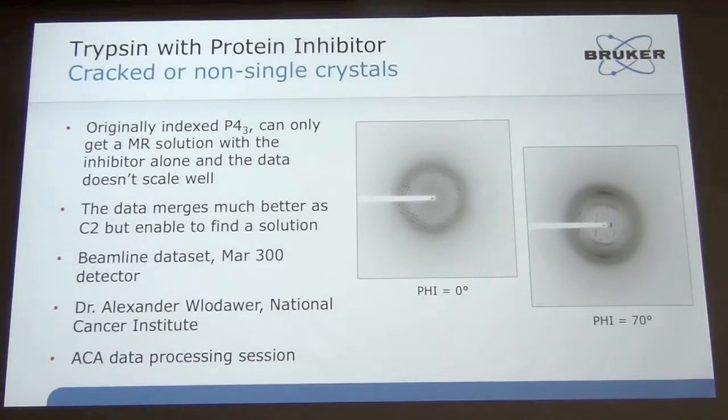You can also use RLATT for things that just don't diffract well, not necessarily twin. This is an example from the data processing session you probably heard about. This is a sample of a trypsin with a tightly bound inhibitor. They got the data, and they wanted to see if they could solve the structure. At phi 0, it looked fine. When you rotated about 70 degrees, the diffraction really fell off. The spots were overlapping. You went a little farther, radiation decay set in, and the data set was pretty much gone by the time you got to about 120 degrees.